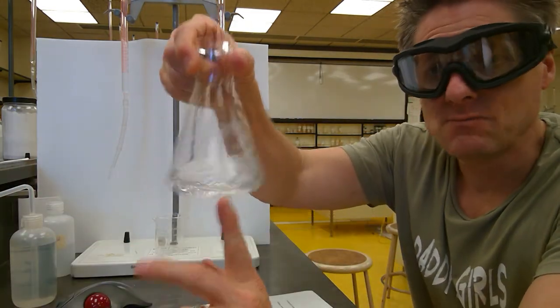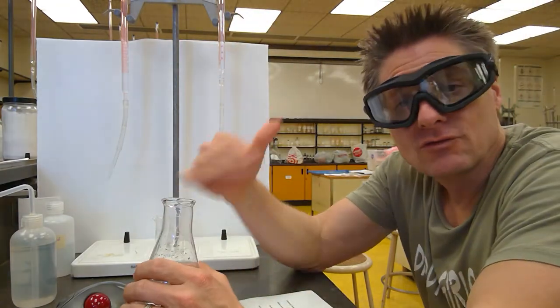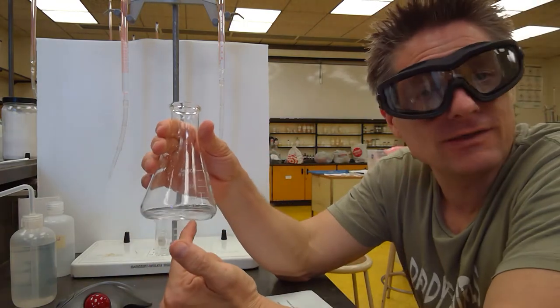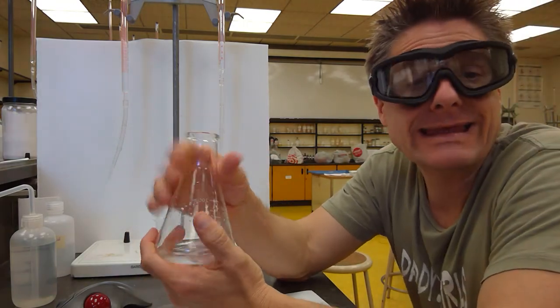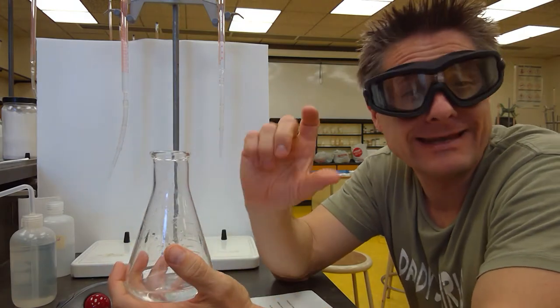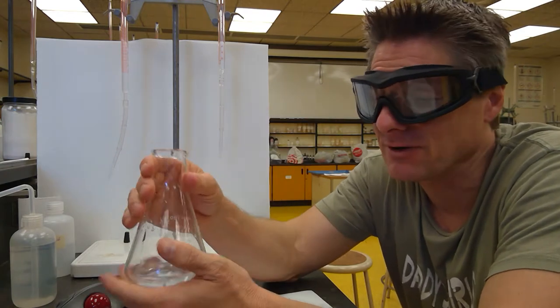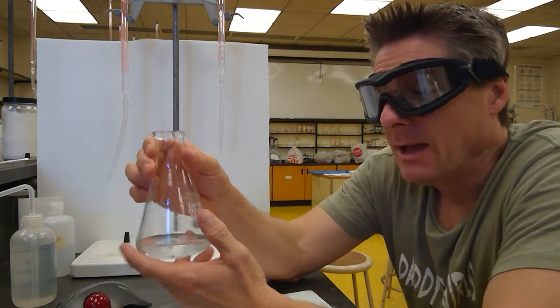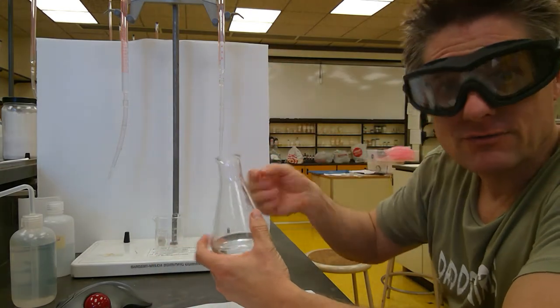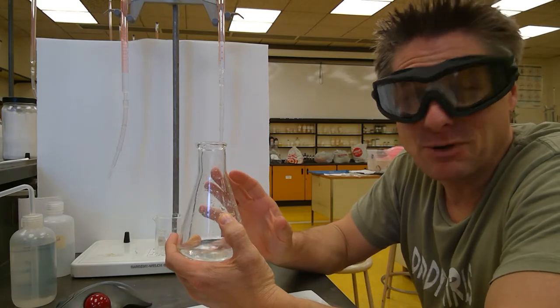So a couple drops. Obviously the color of phenolphthalein in acidic solution is colorless. So we're going to be adding our base until this changes color. That's the endpoint. When the indicator changes color, it indicates where the equivalence point is. And hopefully the indicator has been chosen to match where the equivalence point is. We'll do that in second semester of general chemistry, learn how to predict that. Typically in introductory chemistry, you don't back titrate. You just go real slow and try to not go past that endpoint and get the faintest pink color possible. That builds up paranoia.